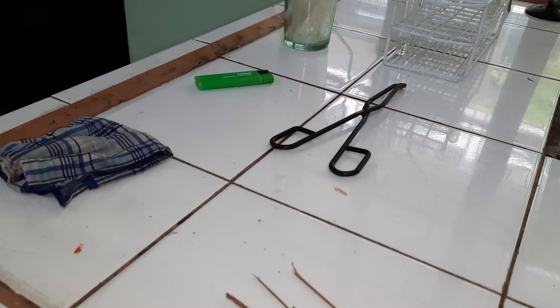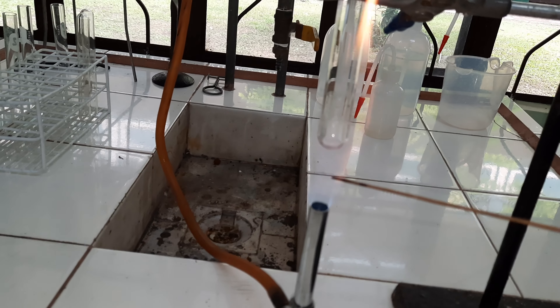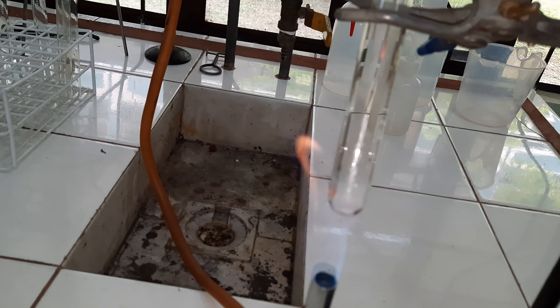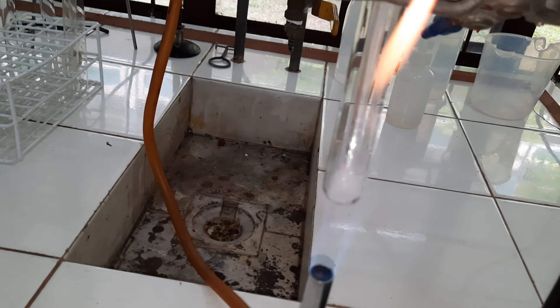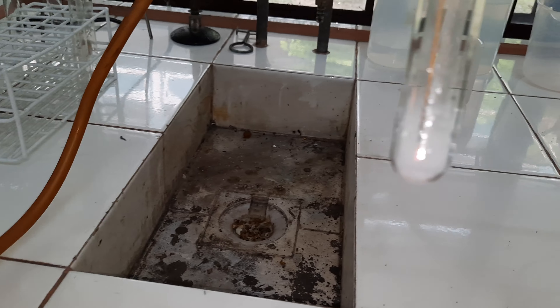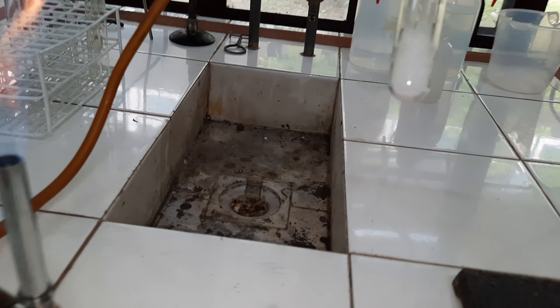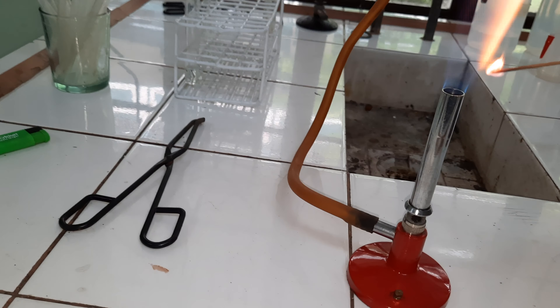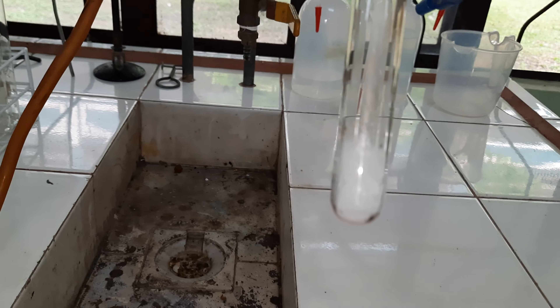Let's boil this potassium chlorate crystal. One more time. So what happened to our glowing splinter as we insert it inside the evaporating potassium chlorate?